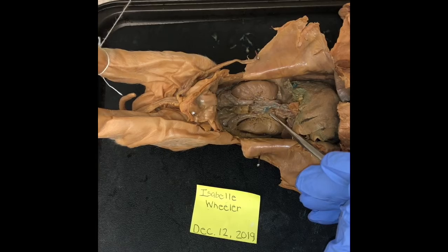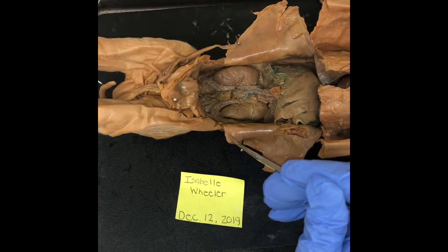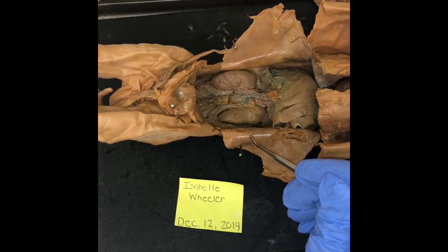It is December 12th of 2019 and it is week 7 video lab exercise of the anatomy of the urinary system. In this video, I'm going to be dissecting a fetal pig and then identifying the different structures of the urinary system. Okay, so I have dissected the fetal pig, and right here is the blood vessels of the kidneys.